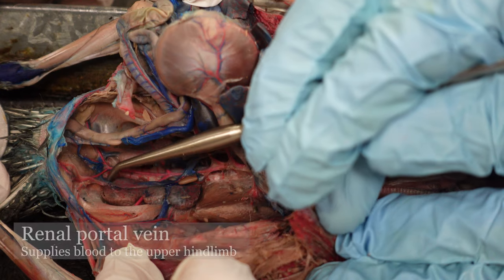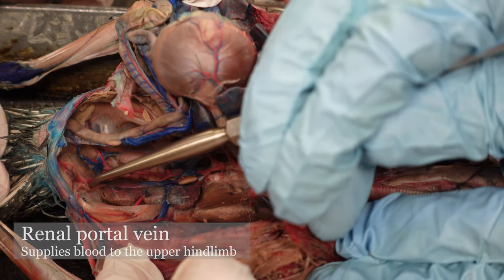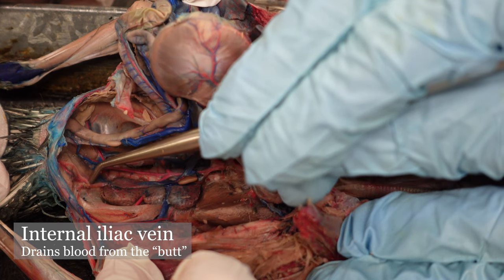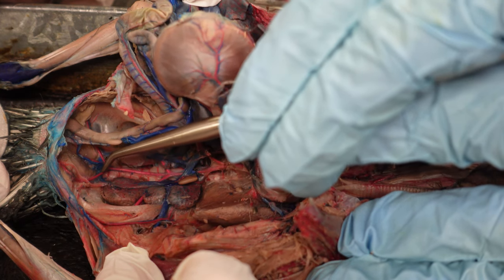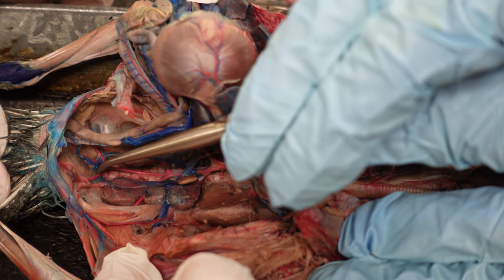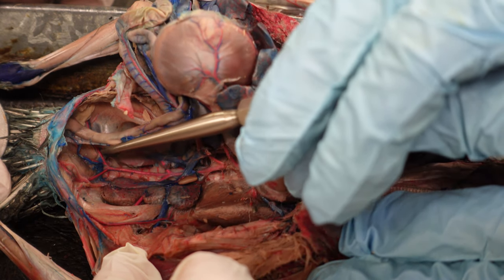As we go down, this is the renal portal vein. We can't see it here — if we dug down a little bit we would be able to see it, but we're not going to do that because this is the student's pigeon. This is the internal iliac vein going up alongside that internal iliac artery. And once you get beyond that internal iliac vein, this is the inter-iliac anastomosis. We're not having you learn it, but it is just a cool term so we wanted to share.